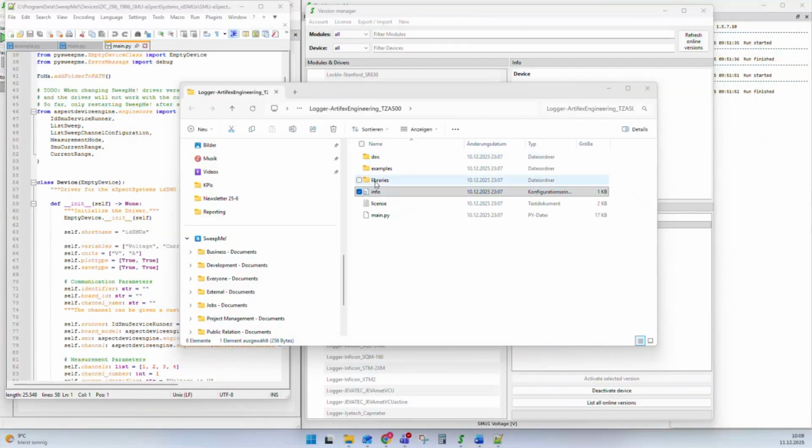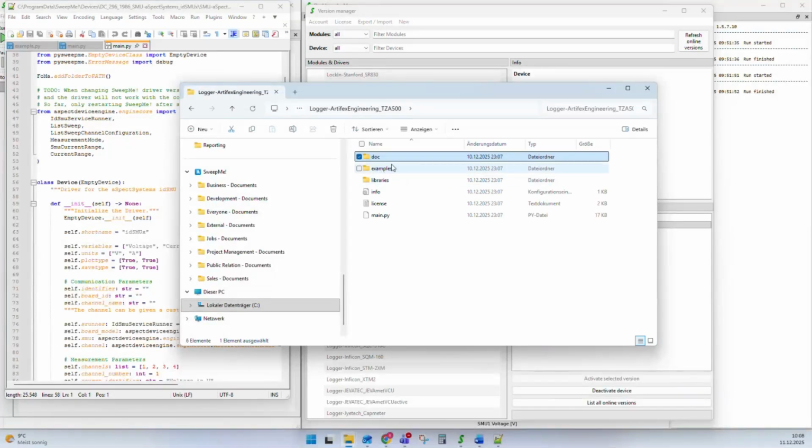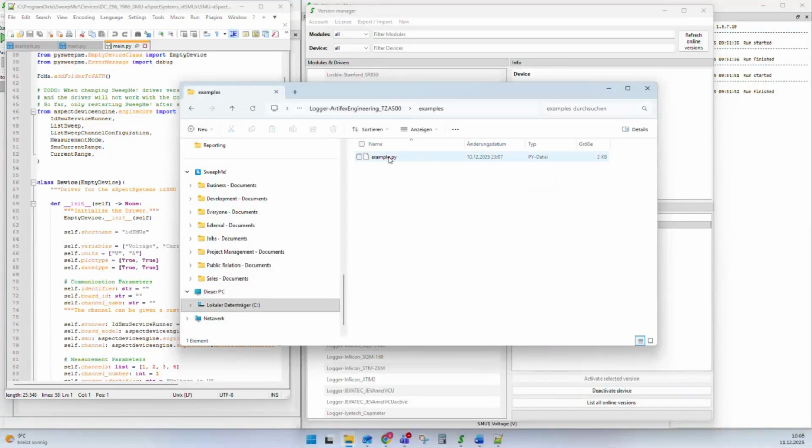Okay, and then there can be additional folders. These additional folders are, for example, the documentation. In the documentation, you can have a markdown file and also additional images. We have examples here. Examples are Python scripts that show how to use the driver in your own Python environments, which means in your own Python projects.